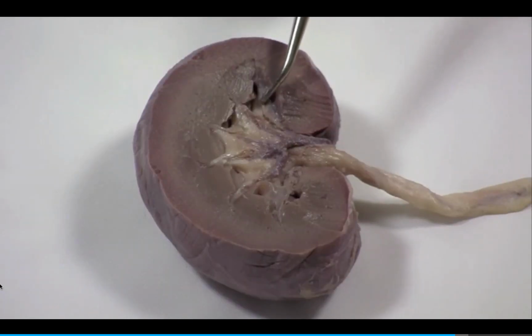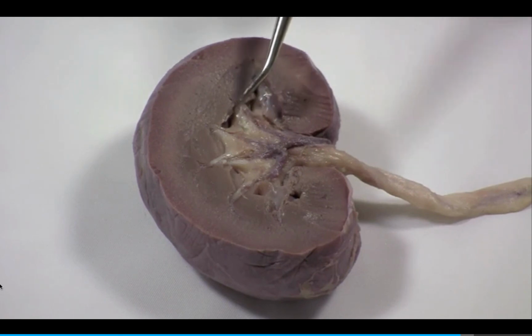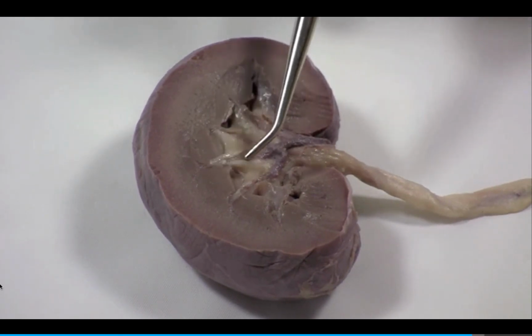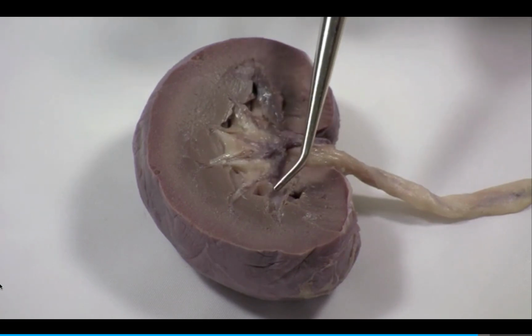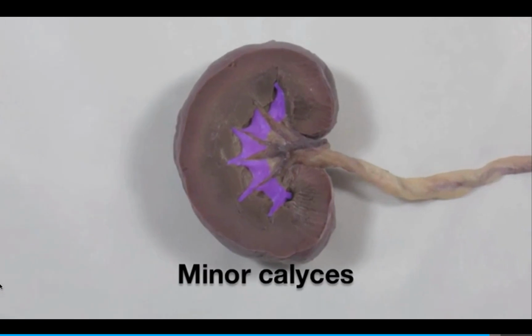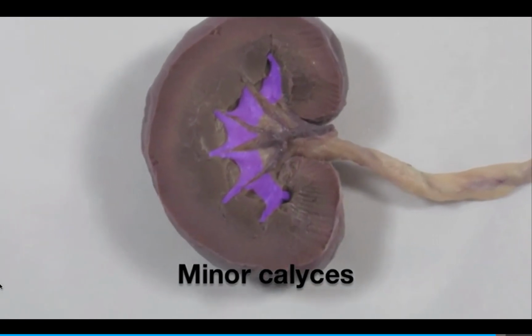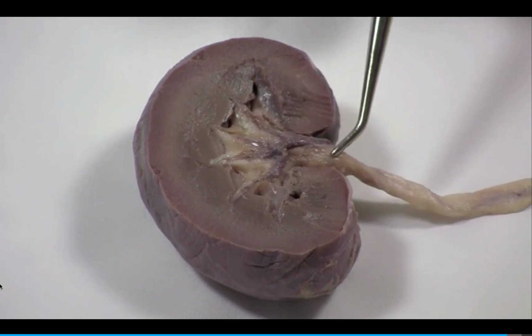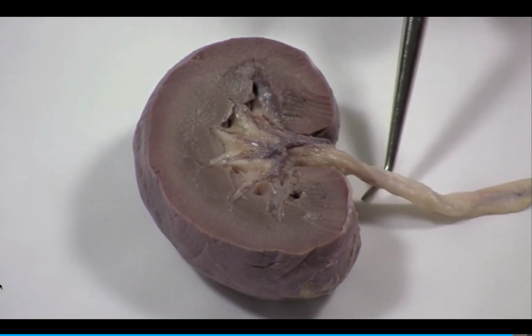The extensions of the major calyces that reach out to the renal papillae are called the minor calyces. The minor calyces of the renal pelvis collect urine from the renal pyramids. The ureter carries the urine from the kidney to the bladder.